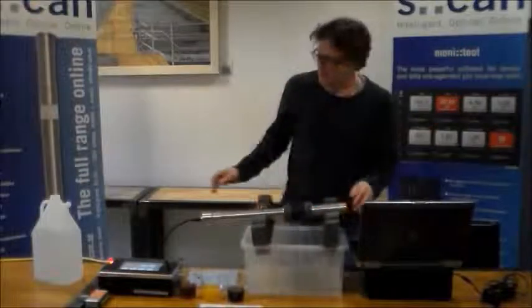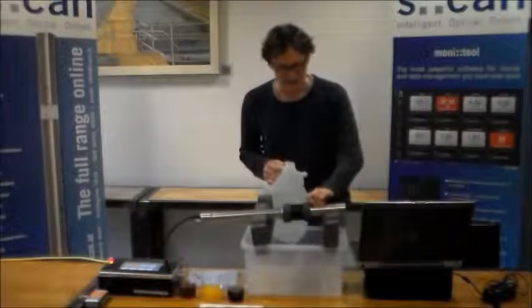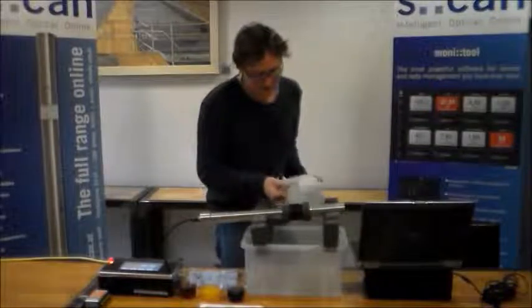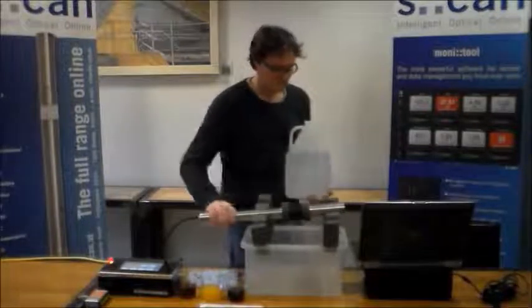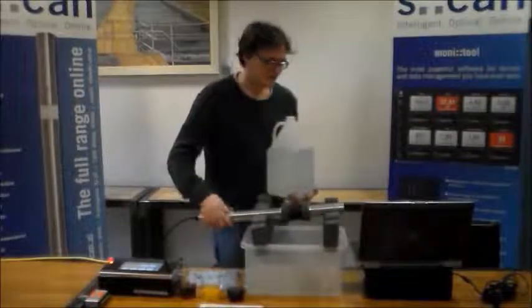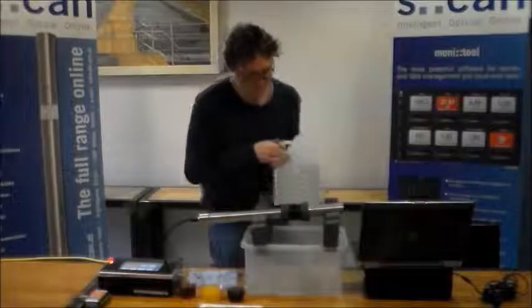And I will now replace the water in the reference slide in order to end the contamination alarm.